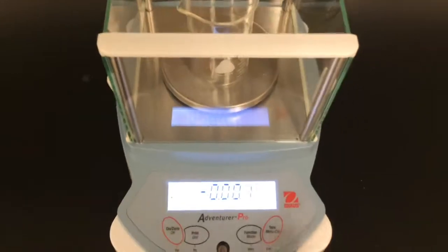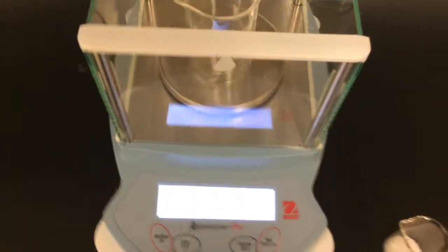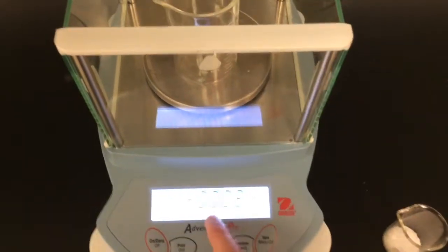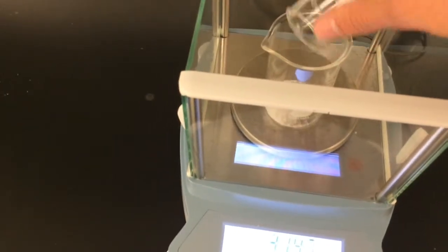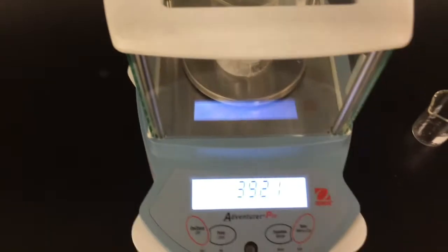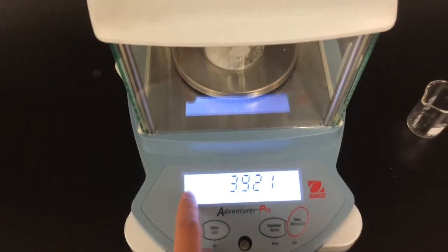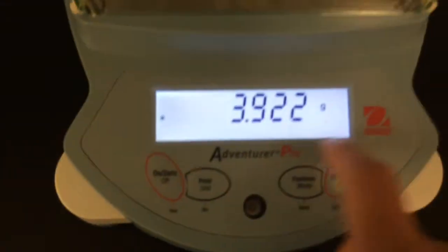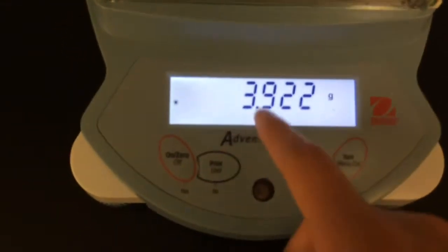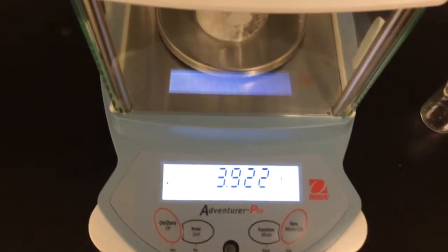I'm just going to grab this, and it will show this because the lid is open and it will have different pressure issues. But let's just pour all this Epsom salt in, and then close it and wait for it to show this little star right there. That'll show that this is what the mass of the Epsom salt is, and only Epsom salt, because we zeroed the beaker.